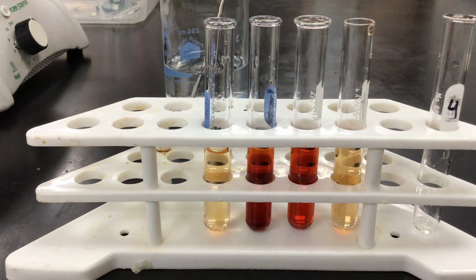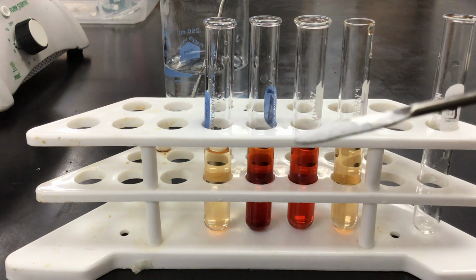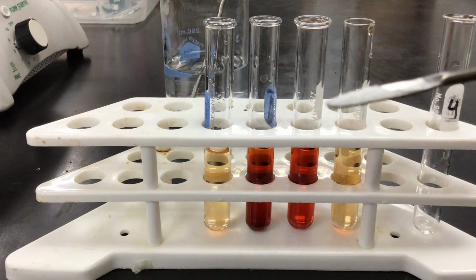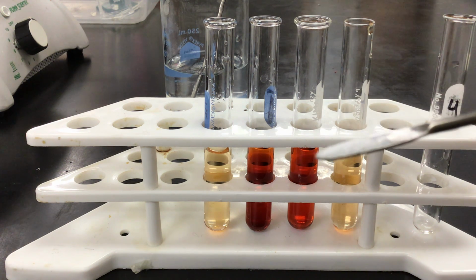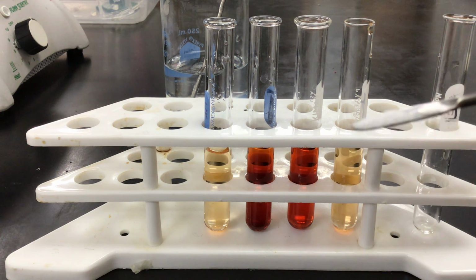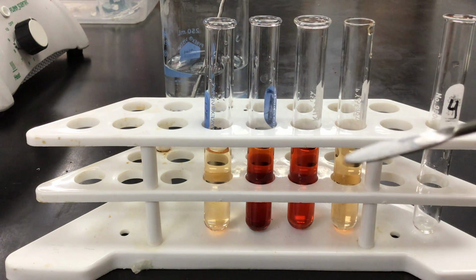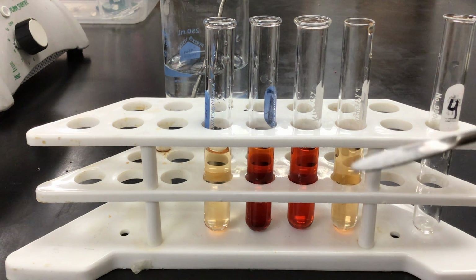Last stress is I'm going to add sodium hydrogen phosphate. Now, phosphate ions, currently, again, it's a white powder, but this is phosphate. When the phosphate dissolves in water, it will bind up the iron ions that are present in the solution, and we'll see what happens when, in essence, this chemical compound will pull iron ions out of the solution.